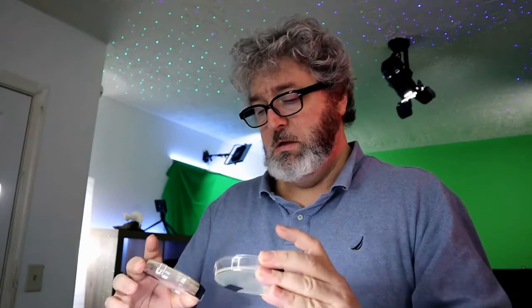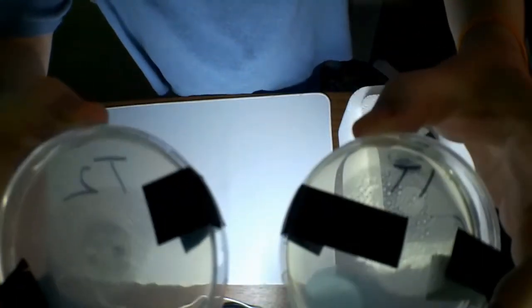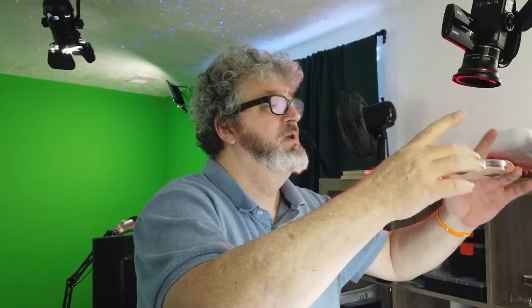Alright, what's next? Toothbrush. Well, I will be really happy to say that there is no bacteria on the first toothbrush, and one small spot on the second one. So I was really worried about this one. I was worried I was going to gross myself out. But my toothbrush, generally bacteria free. Because there was nothing significant in the first one, it kind of makes it hard to tell.